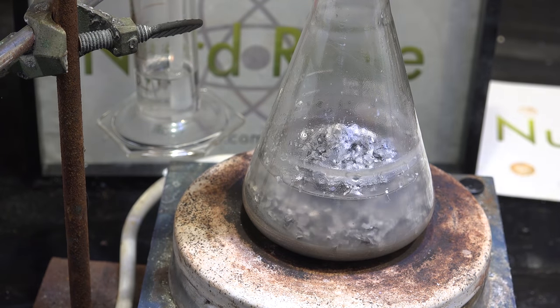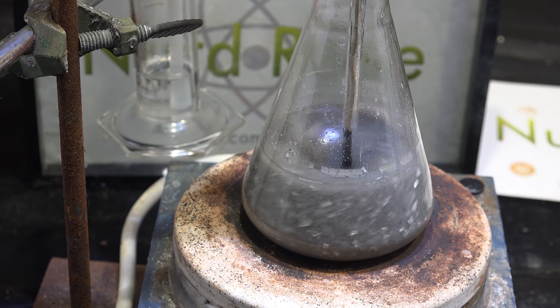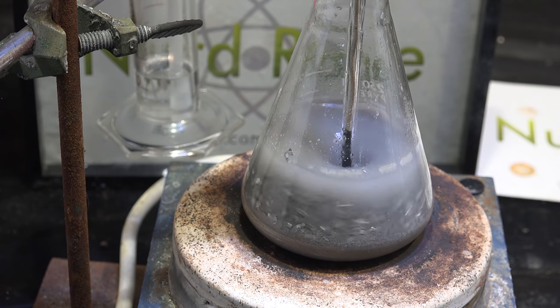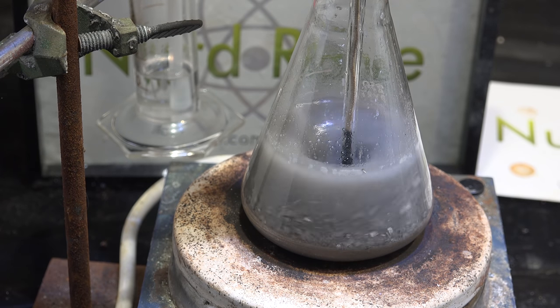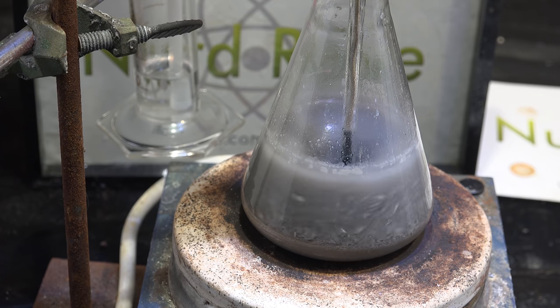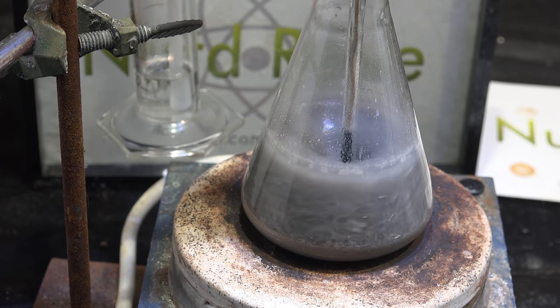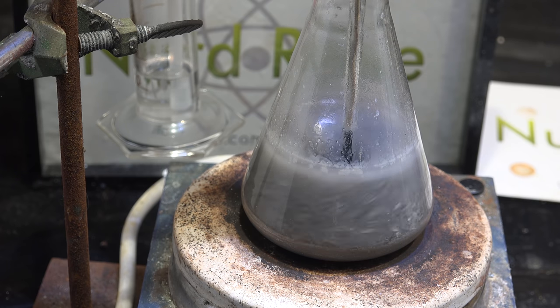Not to let an experiment go to waste I add magnesium anyway and still proceeded to try and make sodium. This was to figure out if aluminum has a negative effect on the sodium production reaction. I'm not sure if this is ultimately important but I figured this was good data to have in case we decide to use aluminum vessels or other aluminum reactants in the future.